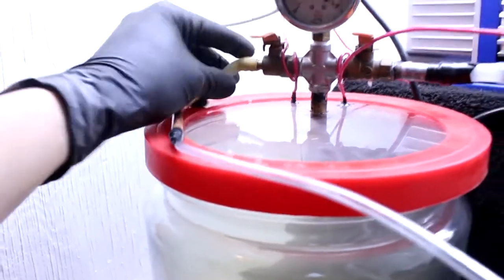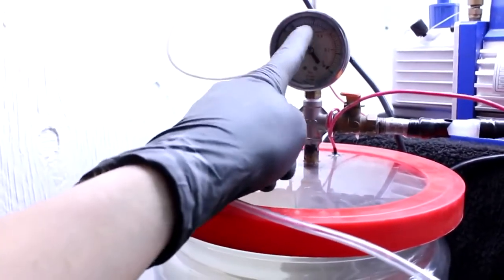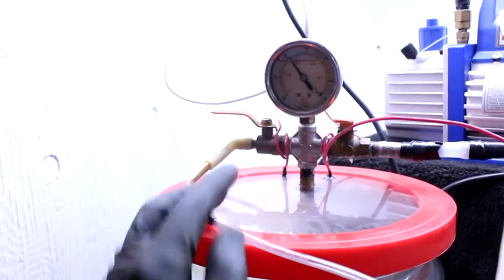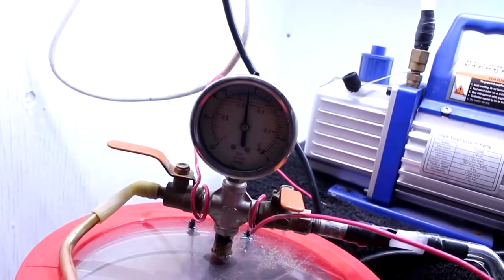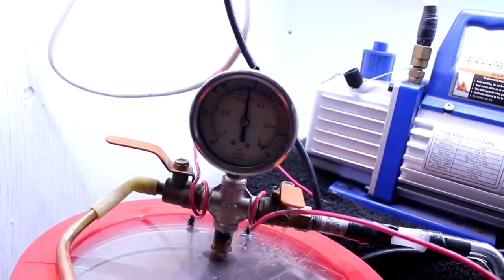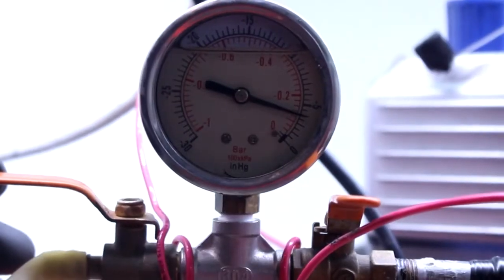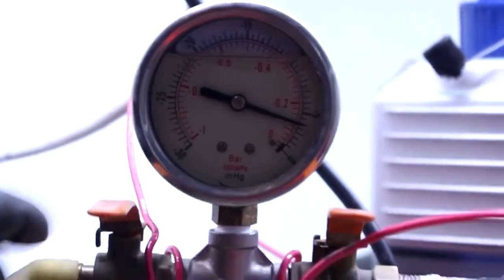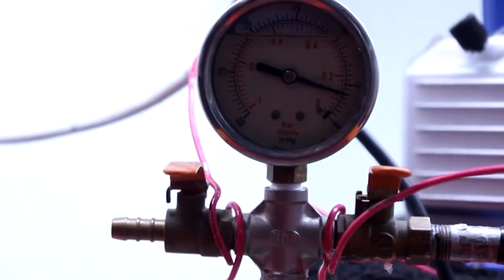Now I'll turn that off. I have a hose connected to a bottle of pure nitrogen, which I'm going to add to make up the rest of the atmosphere. There's the nitrogen going in. Actually, I'm going to stop there — I want to leave the chamber under a slight vacuum.